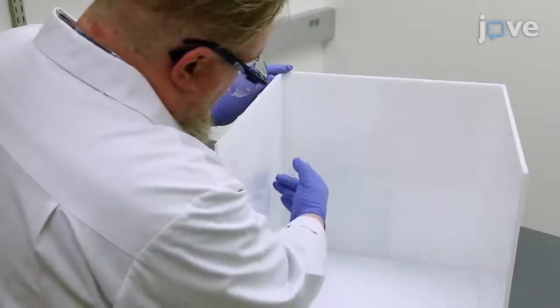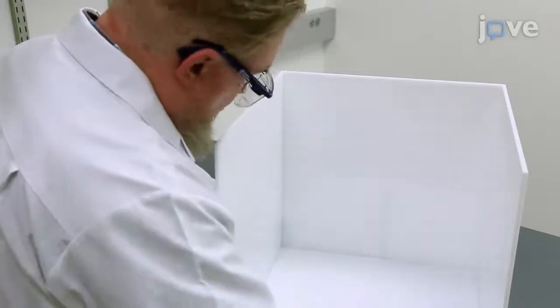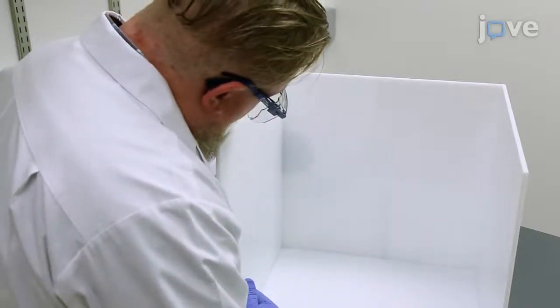Finally, use the syringe to apply a small and steady bead of cement directly to the corner now being formed by the outside wall and the inside wall.